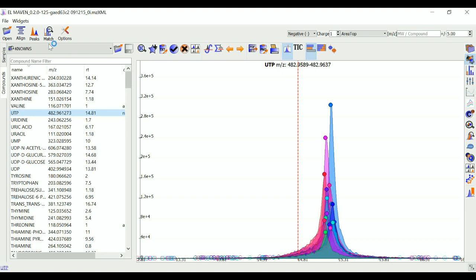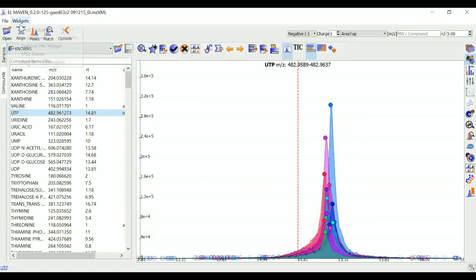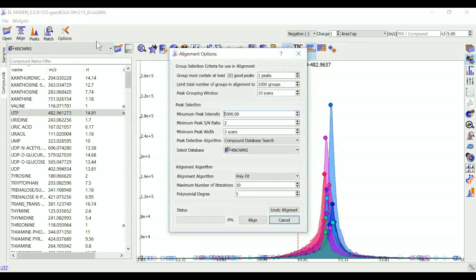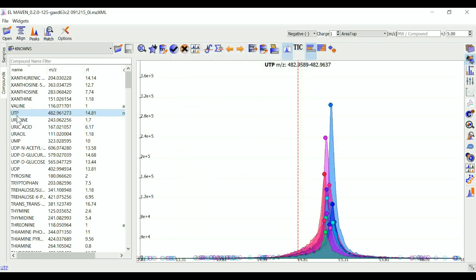Click on the Align button to set its parameters. The first panel in alignment options is for group selection criteria. Group here refers to a set of peaks across samples that are annotated as a particular ion. This is a group for UTP.